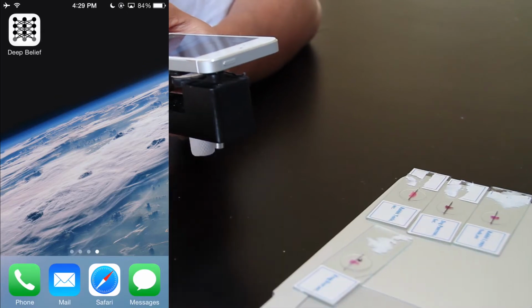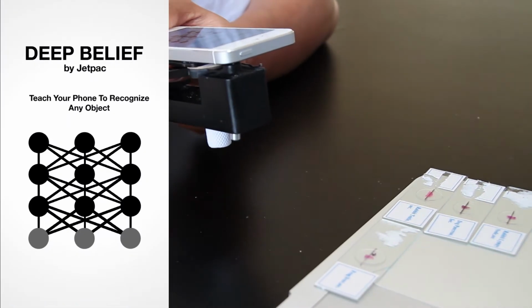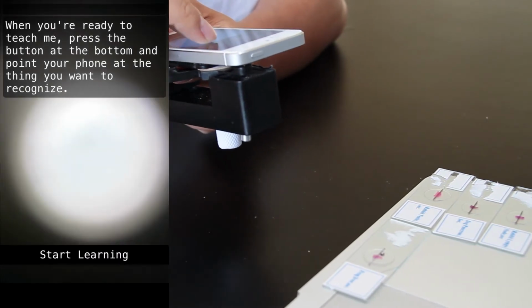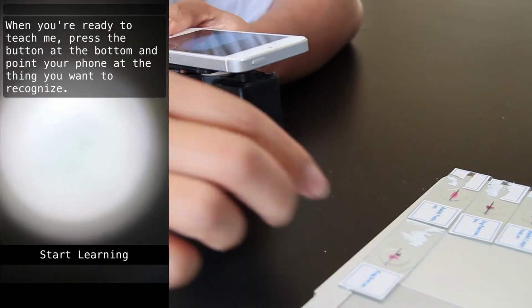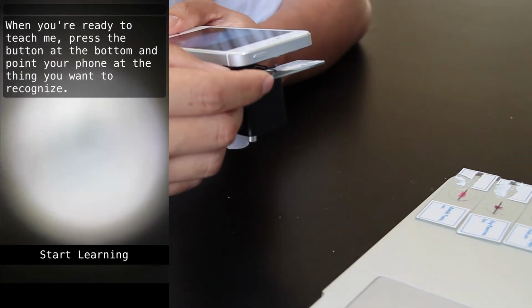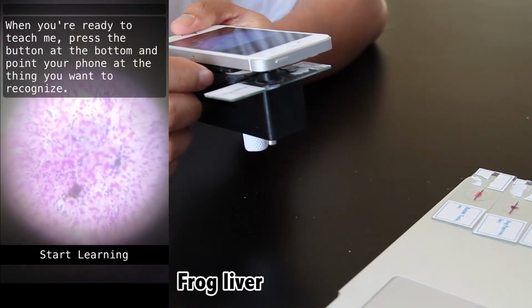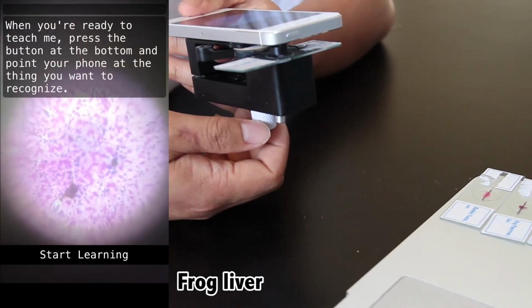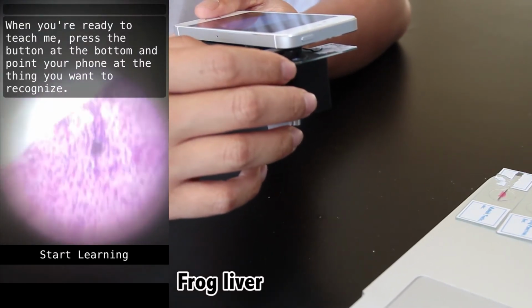So the app I'm using is called Deep Belief by Jetpac, and what I've already done ahead of time is separate the slides I'll be using into a training set and a testing set. The reason I do this is because if we want to check whether or not this algorithm can actually tell the difference between different types of tissue, we want to test it on something it's never seen before. Because otherwise it'd just be able to match it up. It'd be kind of like providing a practice question with the answer and then putting the exact same question on the exam. It's not a really good test.